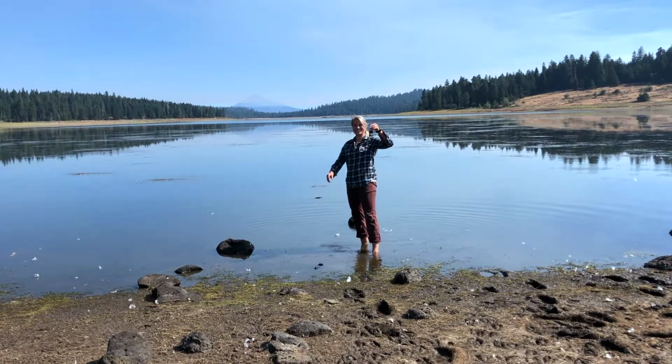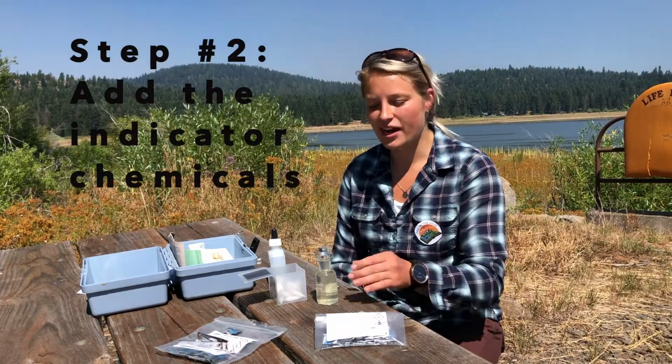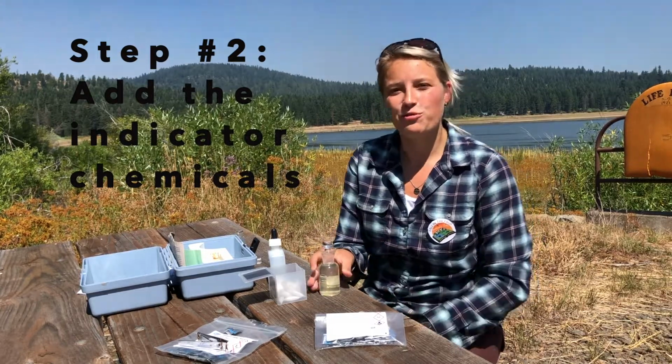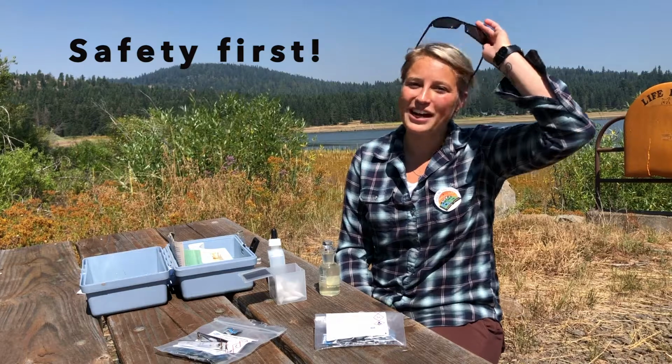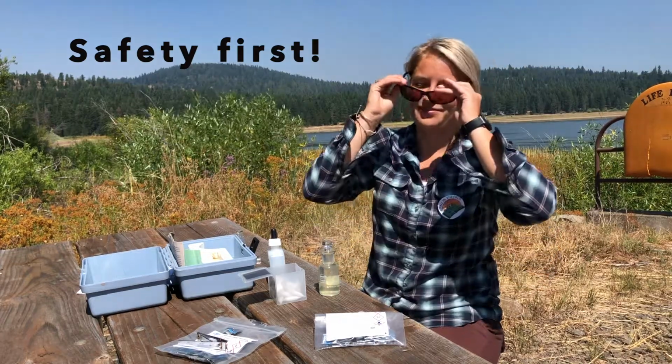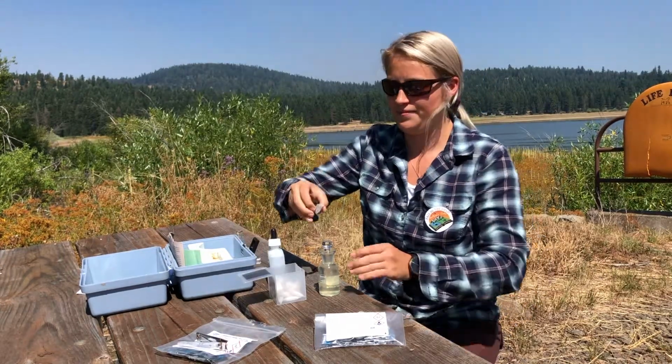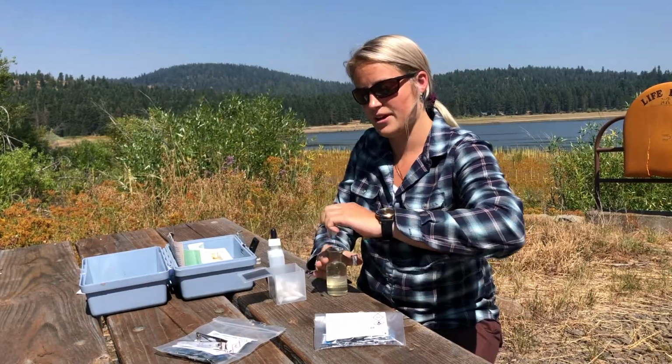There we go. So step number 2 is now we are going to take our sample and we're going to add the chemicals. So before we do this, I'm going to make sure to put my safety glasses on. And then first I'm going to put dissolved oxygen number 1 in. So I'm going to remove my stopper.